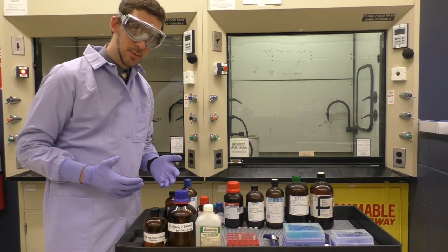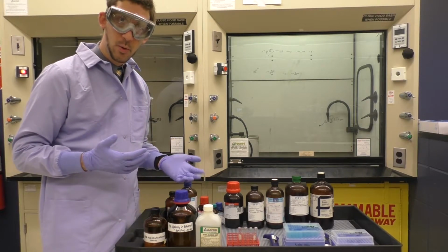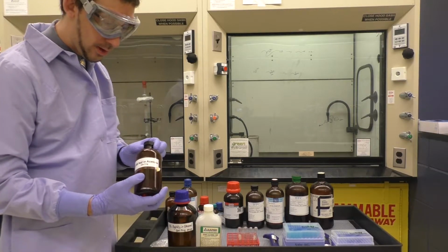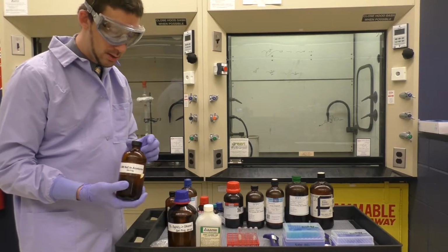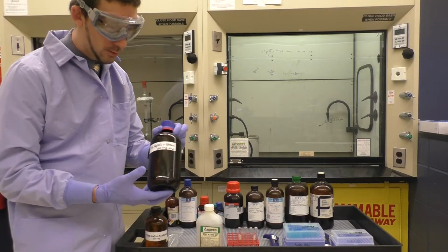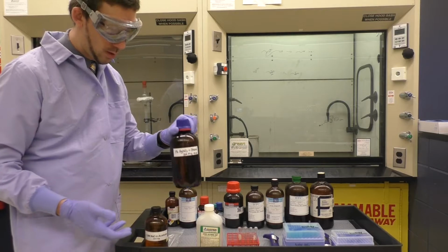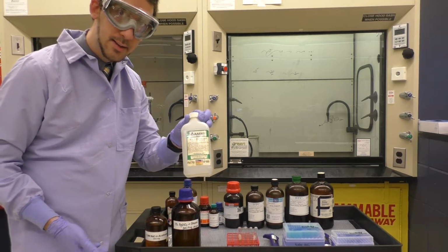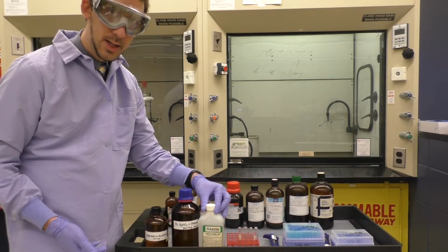Now, to actually perform the reaction, the other reactant, depending on whether it's SN1 or SN2, I have those here. I have a 1 molar solution of sodium iodide in acetone. This will be for the SN2 portion. I have a 1% silver nitrate solution in ethanol. This will be for the SN1. And I have some extra ethanol, and I can use extra acetone from a wash bottle if needed.